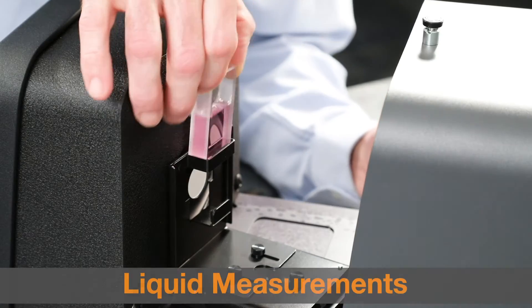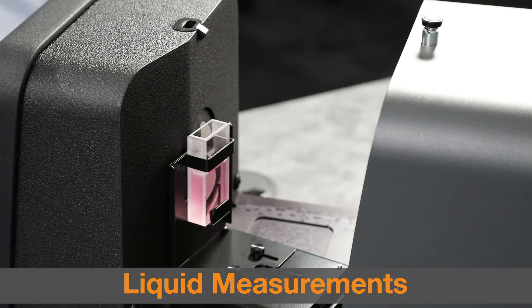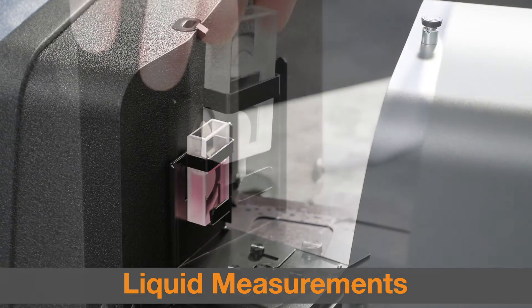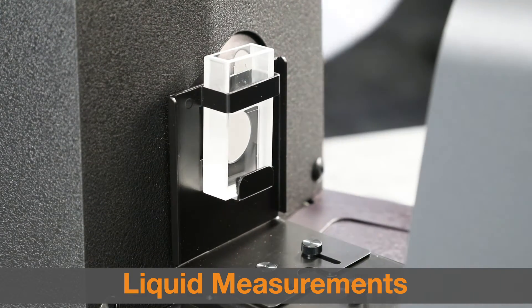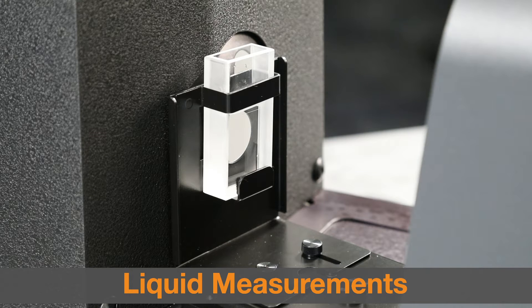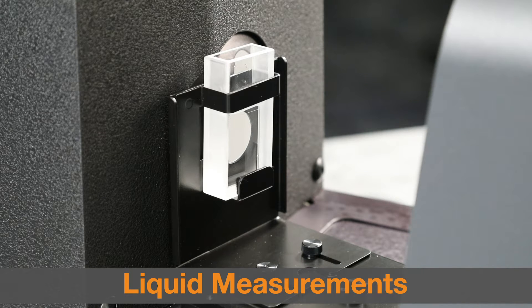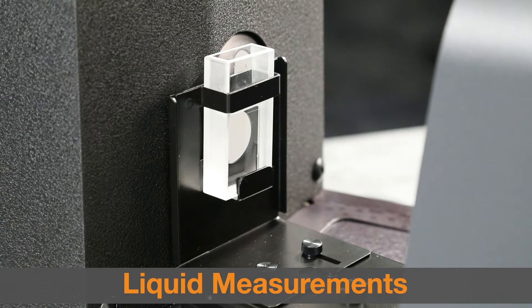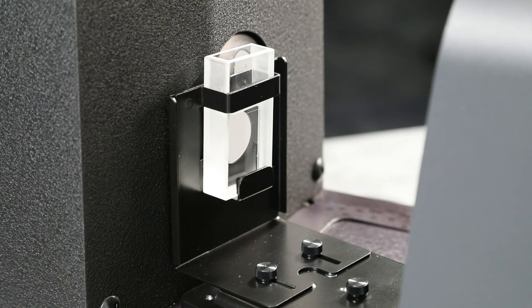Finally, when measuring liquids, you should always use the total transmission technique and the provided cuvette. Perform white calibration with the cuvette and clear liquid in the sample holder. When performing black calibration, the blocker should be positioned between the cuvette and the opening in the sphere.